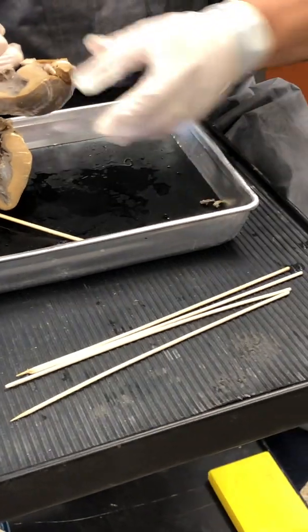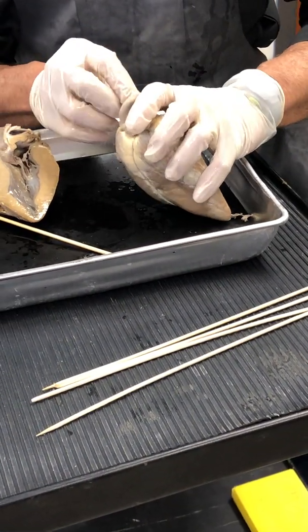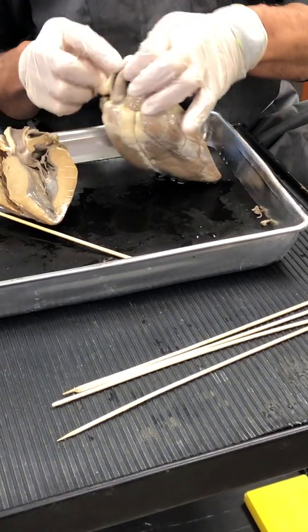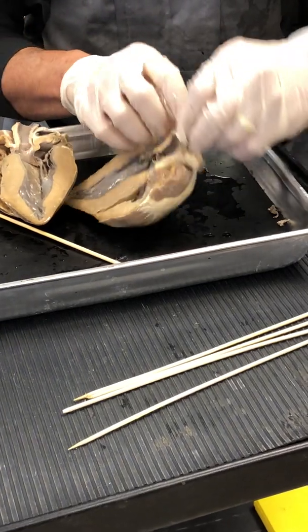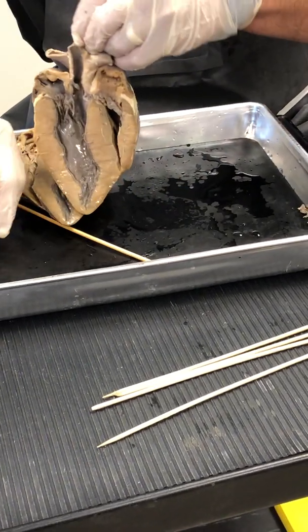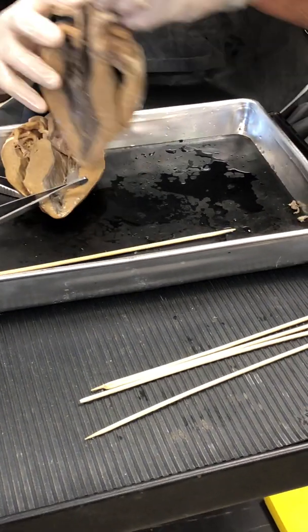That's blood, that's a blood clot. There's right there. All right? Or that, and then also, folks, you cut it. So I've cut it open like that so you can look into it, so you can see the pulmonary semilunar valves in there. So there are the pulmonary semilunar valves in there.